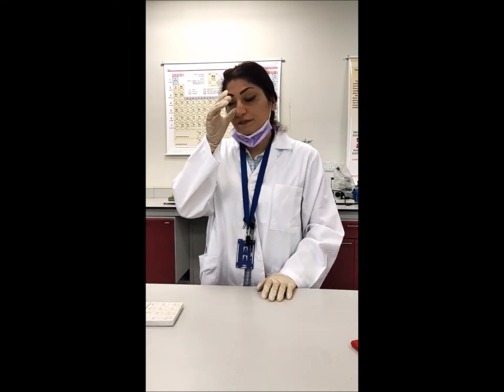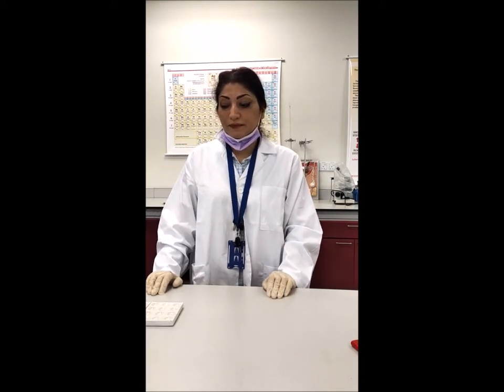Good morning, students. Today I want to show you how to prepare a specimen to watch under the microscope. I have done the sampling in the morning and prepared the samples. But after finishing recording this part of the video, I will go back to the field and show you how I collected the samples.